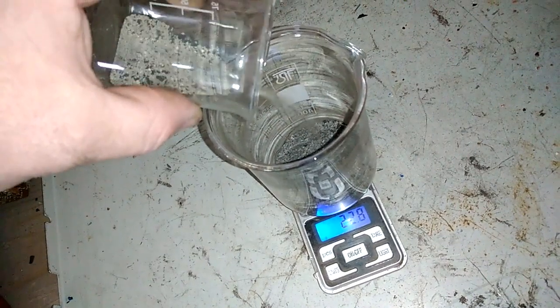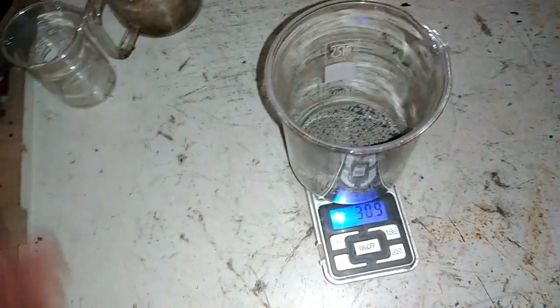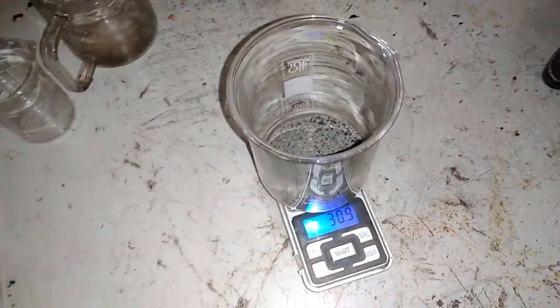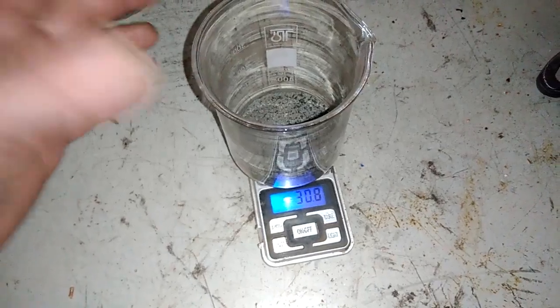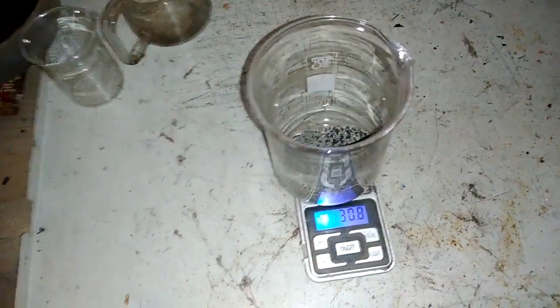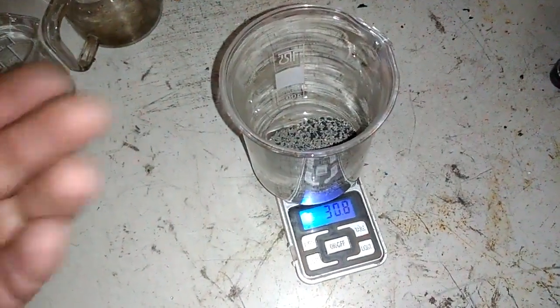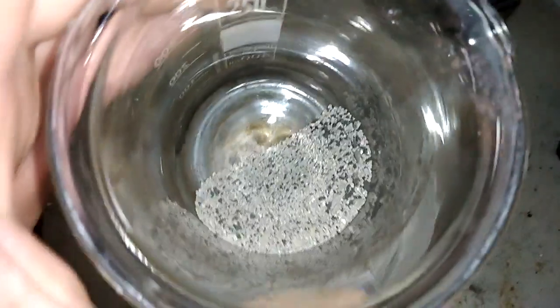Yeah, it's clean. So this is the silver from contact, and 21 grams silver from silver-plated material, around almost 31 grams. Yeah, this is the pure silver dry powder, so there shouldn't be too much loss during the melt step. Almost 31 grams silver from this one drop. Every bead of silver counts.